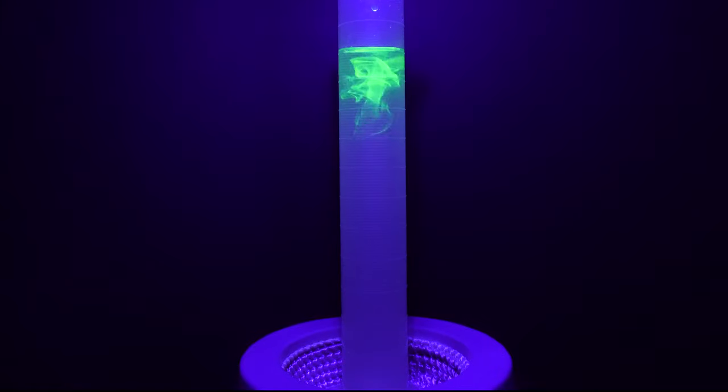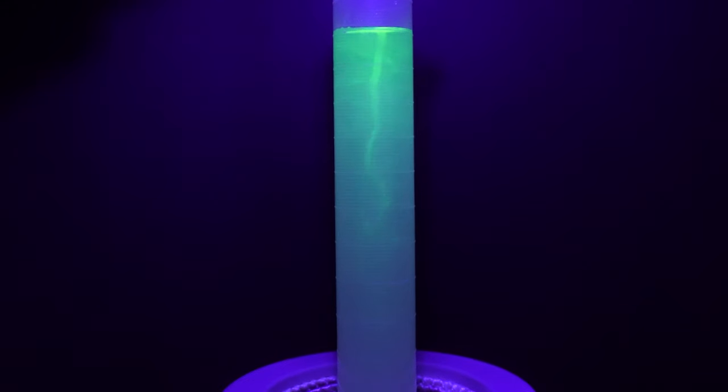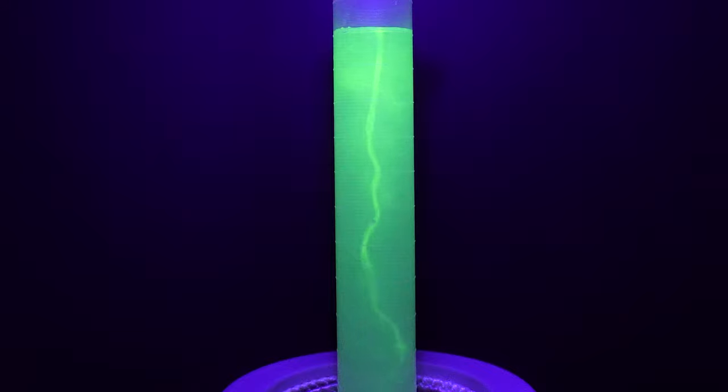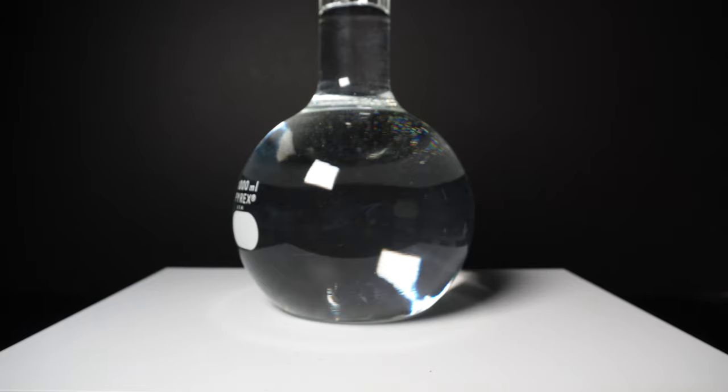Finally for fun, I start by making the famous fluorescein vortex. I've literally spent hours playing with this and I've honestly still not gotten bored. Next we will see a flat bottom flask and play with some additional drops for group viewing gratification.